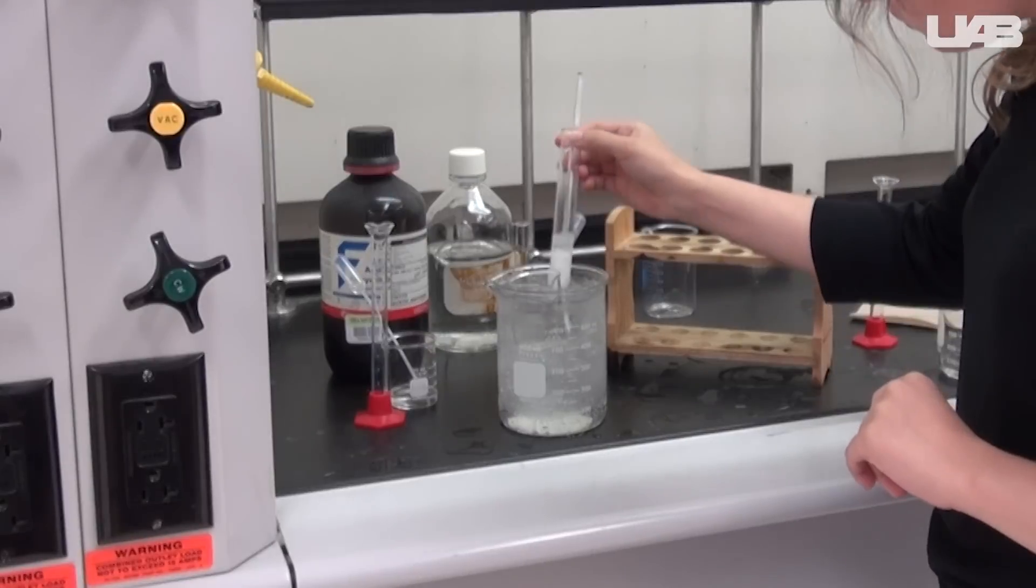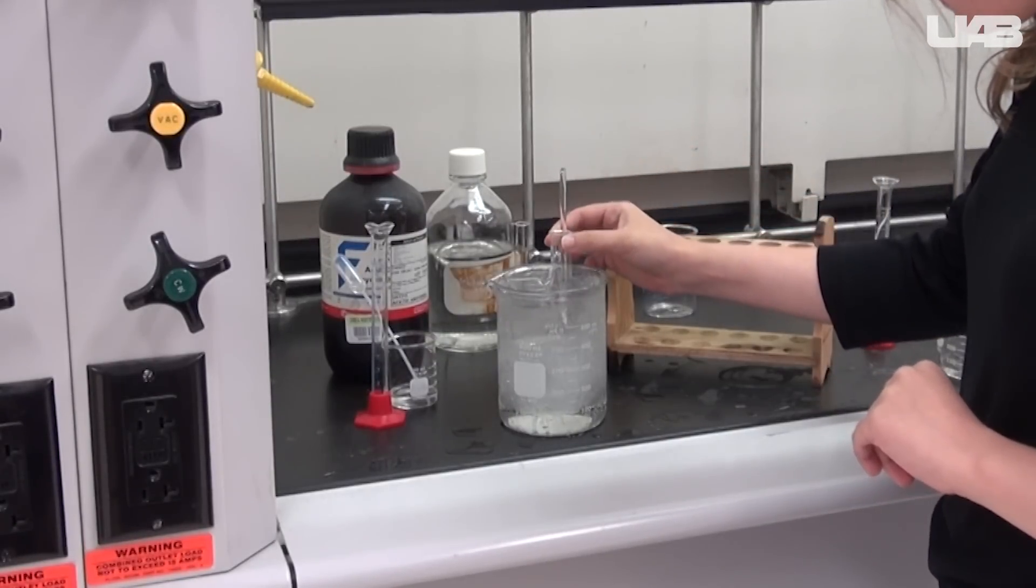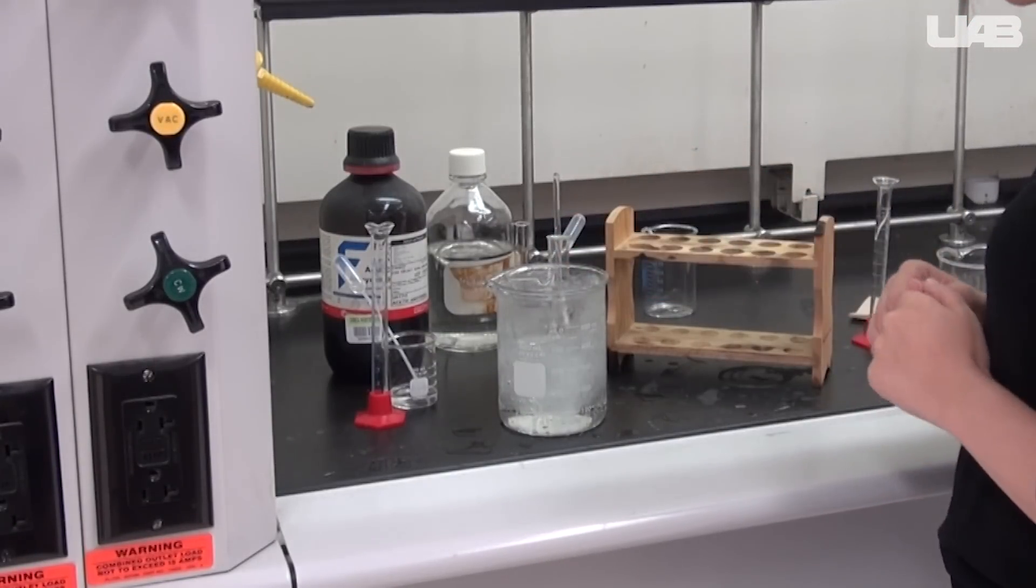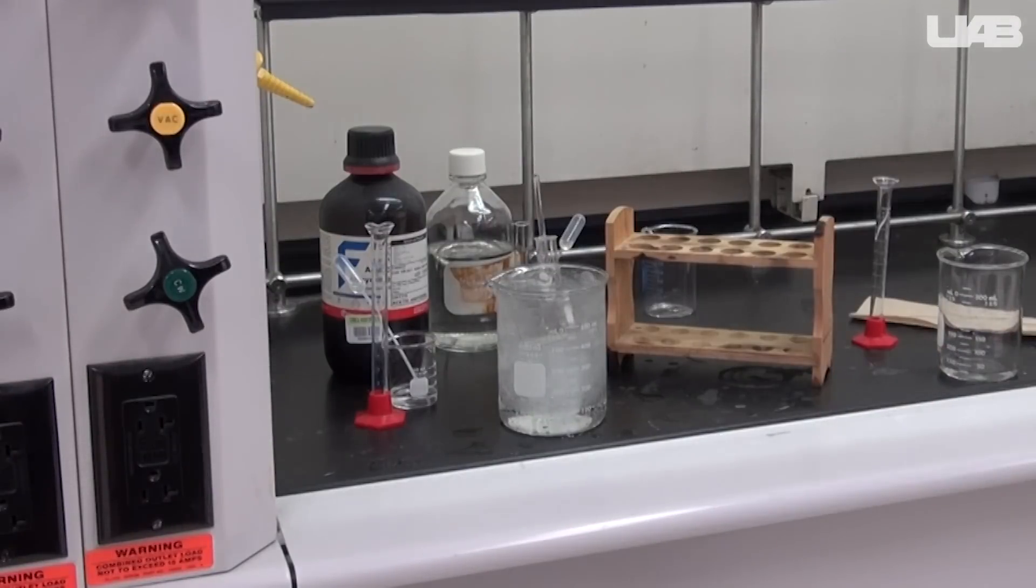Aspirin crystals are expected to form within this time frame, but it might take a little longer. You should talk with your TA at this point if you don't see any crystals.